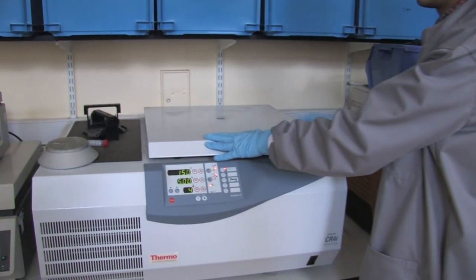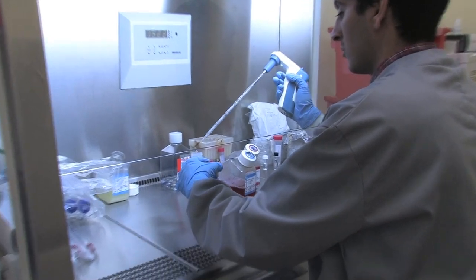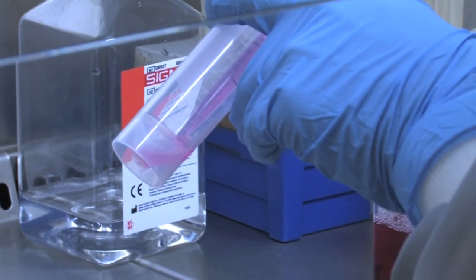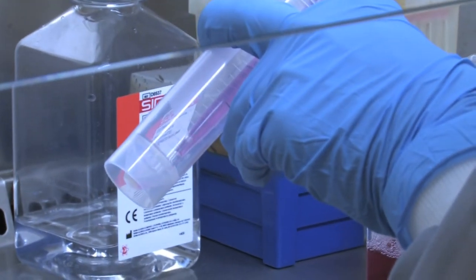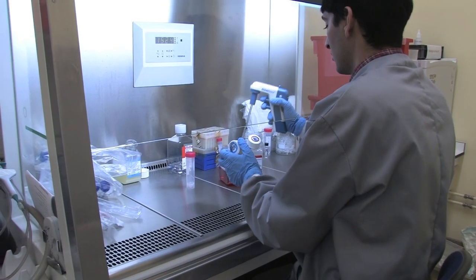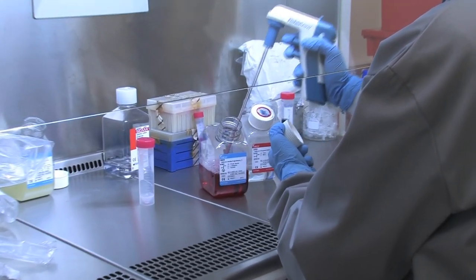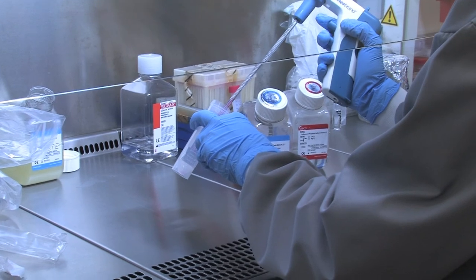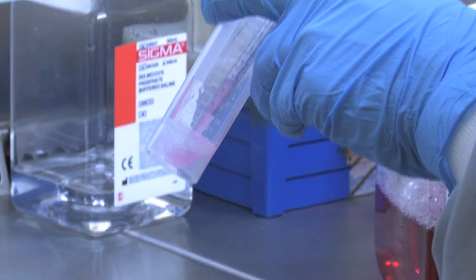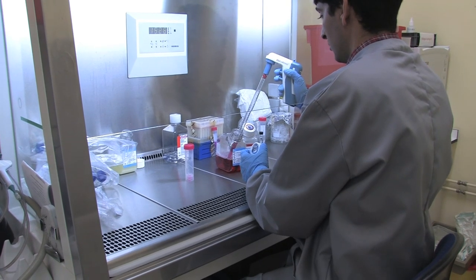The tube is then centrifuged at 150g for 5 minutes to separate the cells. The supernatant is then very carefully removed, ensuring the cell pellet is not disturbed. The cell pellet is then re-suspended in 1ml of pre-warmed complete growth media. The cell suspension is then diluted with 20ml of complete growth media.